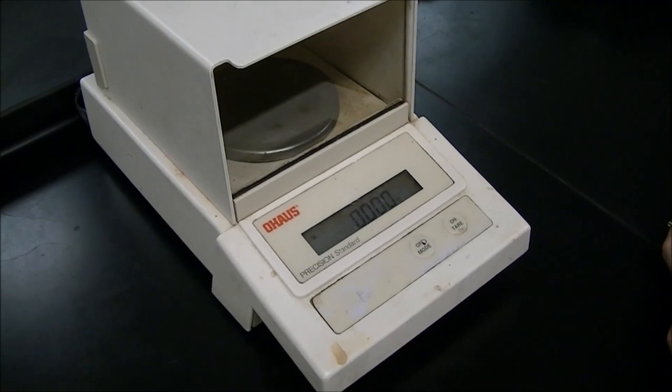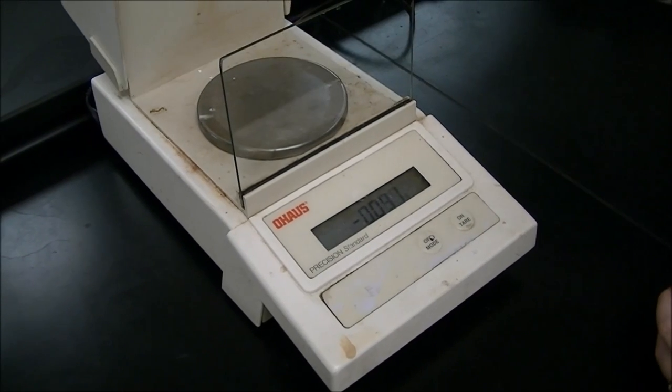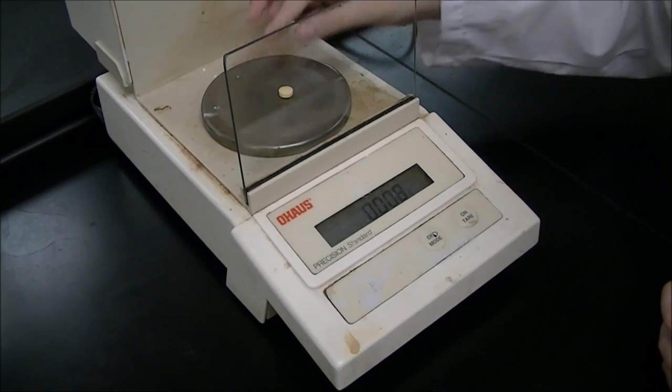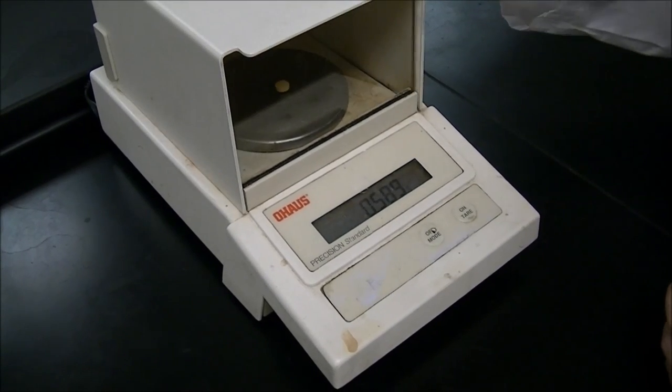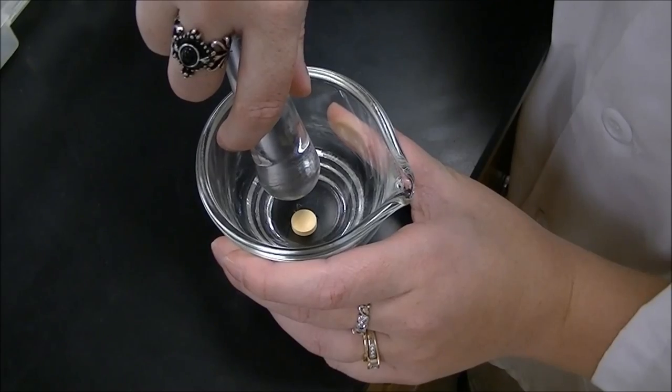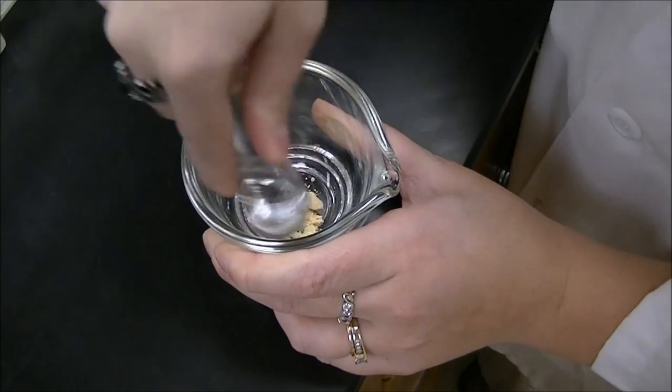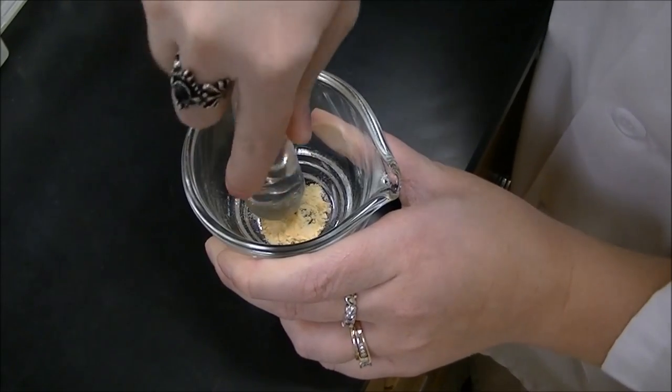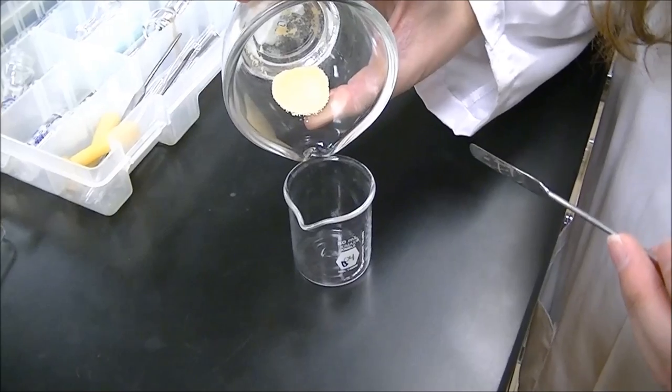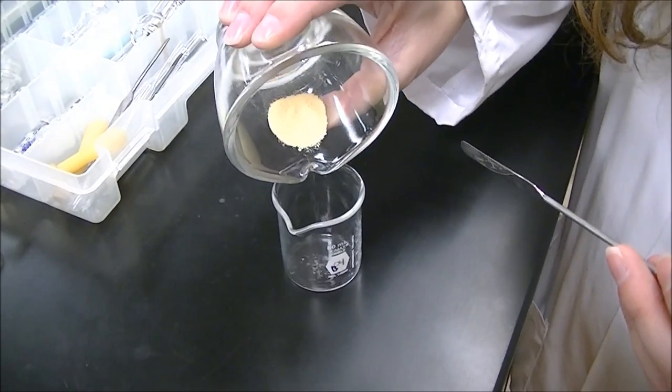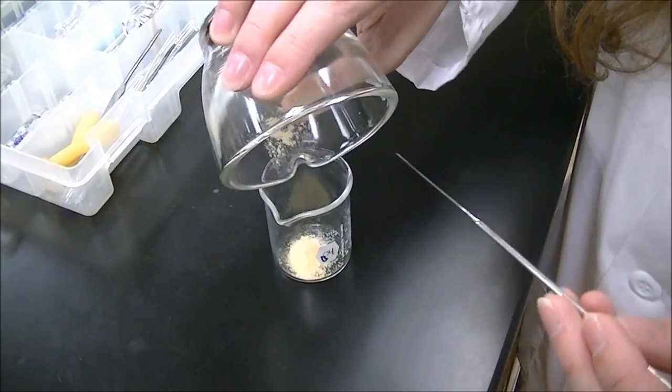Weigh and record the mass of your No-Dose tablet. Using the mortar and pestle, crush the No-Dose tablet into a fine powder. Transfer as much of the tablet as possible into the 50 milliliter beaker.